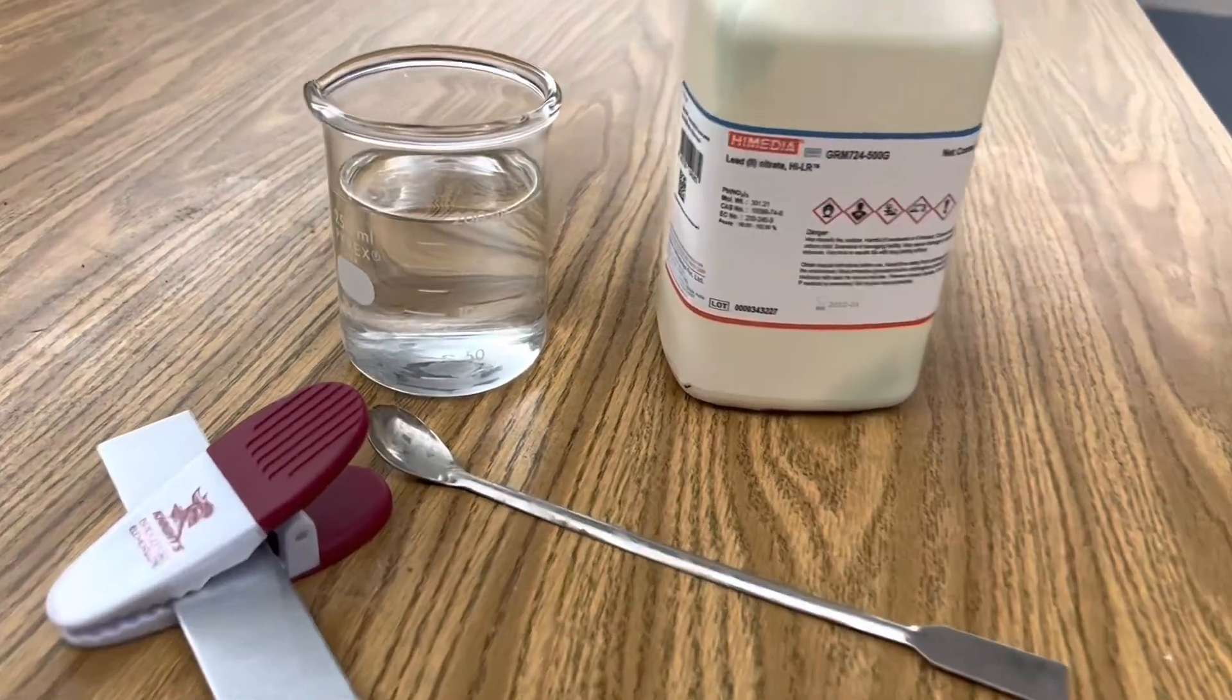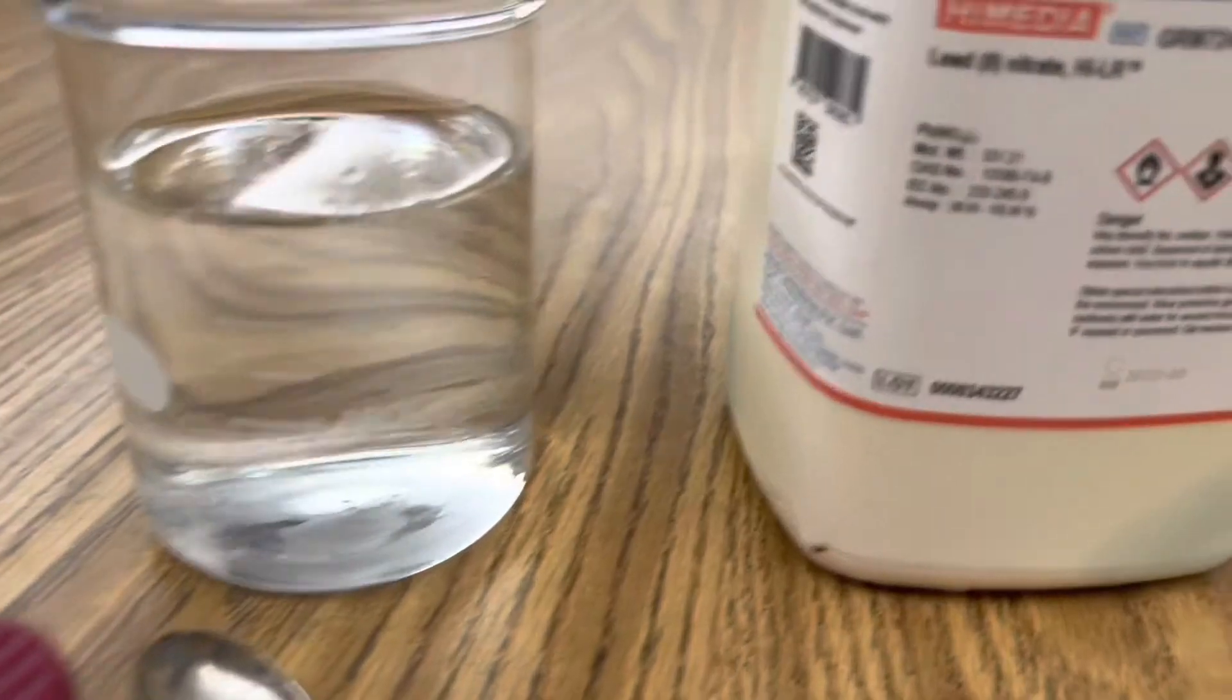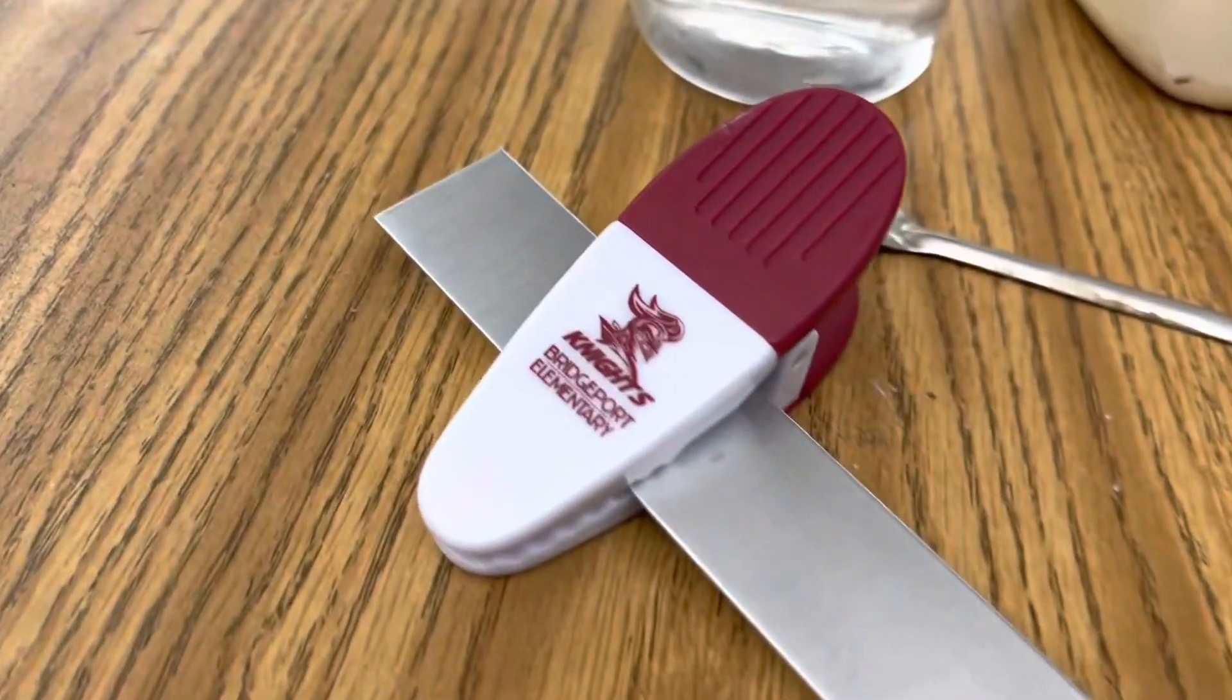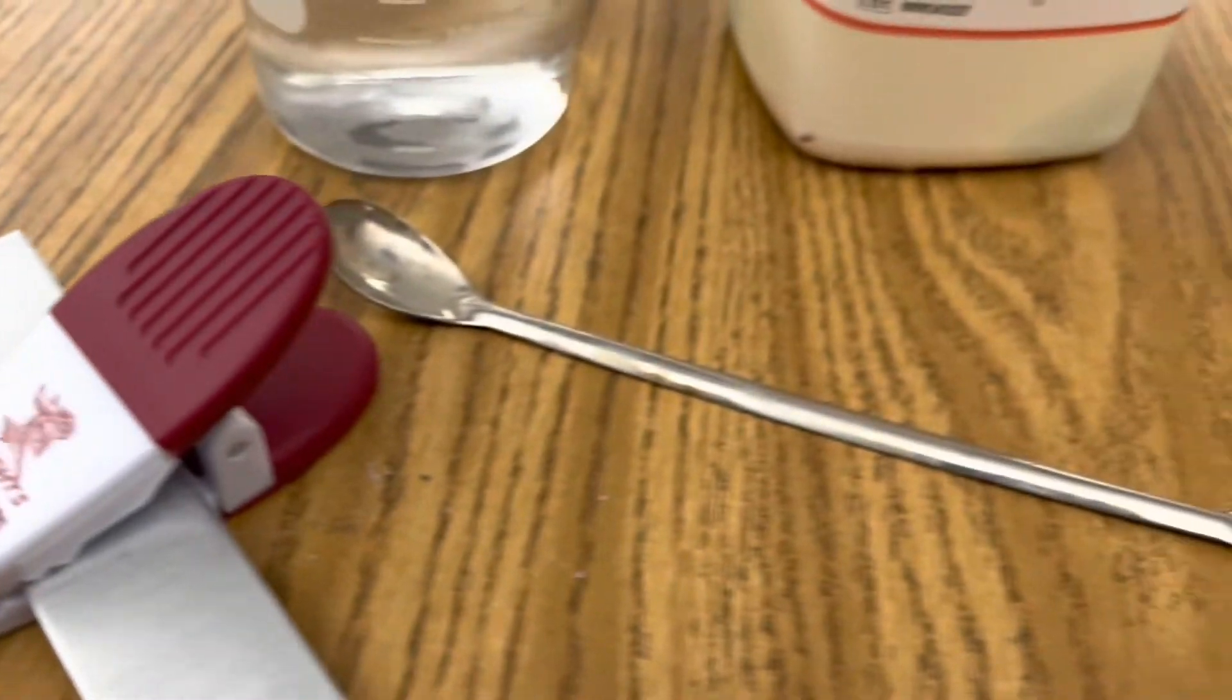All I'm using in this investigation is 200 milliliters of distilled water, lead nitrate, a strip of zinc, this clip to hold it in place, and a spoon.